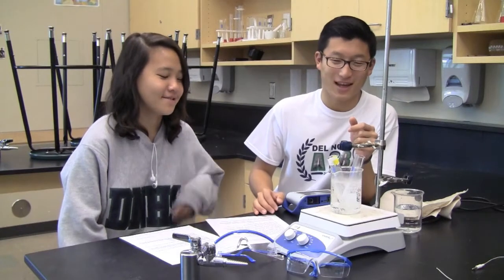Hello chemistry students. Today we're going to be learning about the freezing point depression lab, and we're going to be teaching you how to set up the lab. So first off, what do we have here?